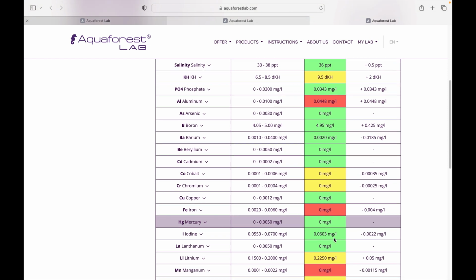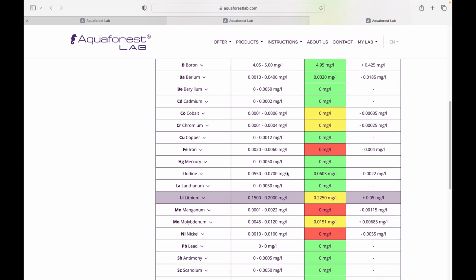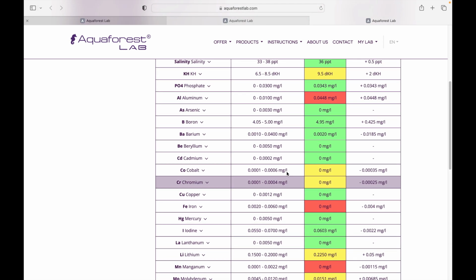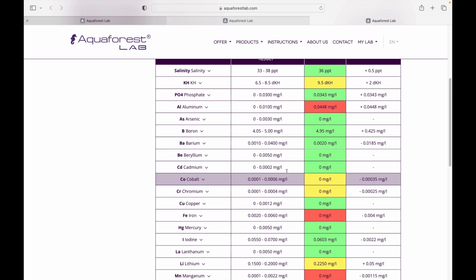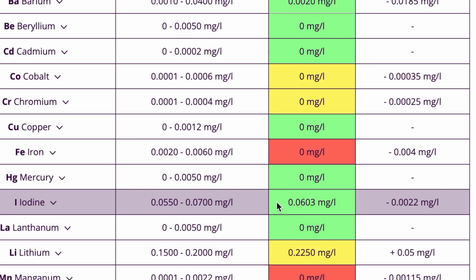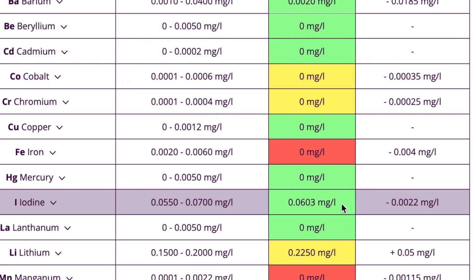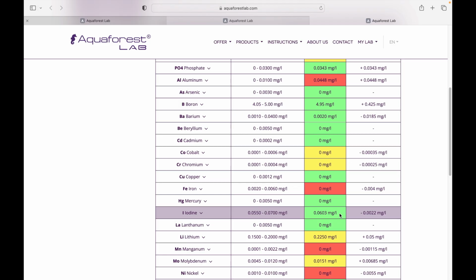It's not a terrible result. I've got some lows, but the concerning part is that we're getting some conflicting readings here, especially with iodine. The ICP Analysis showed iodine as being really high, and I was really concerned when I saw that reading, that there's something wrong with the tank, and it looks like it needs immediate action. But if you look at this test, it's not even yellow. It's fine. So, which is it? Is it really super high, or is it fine?